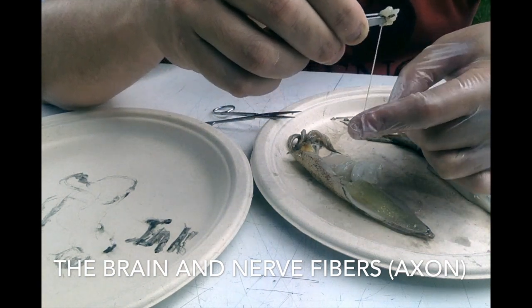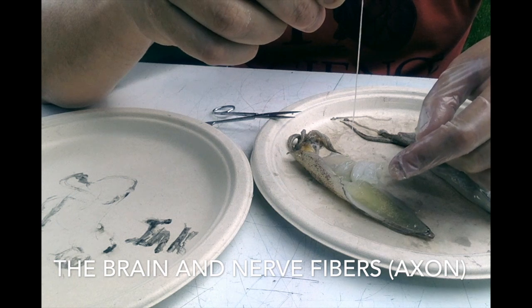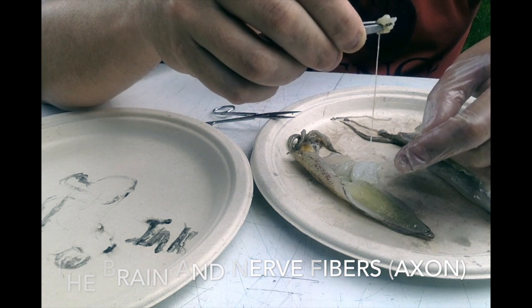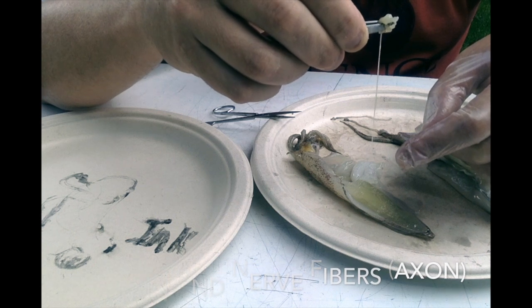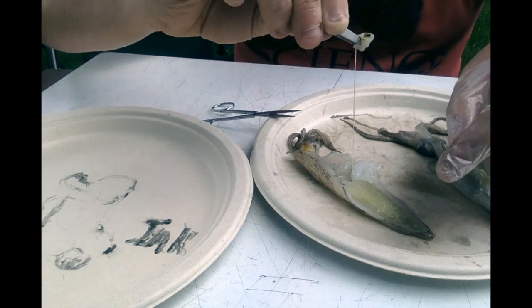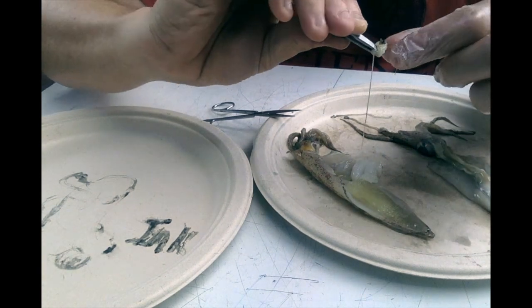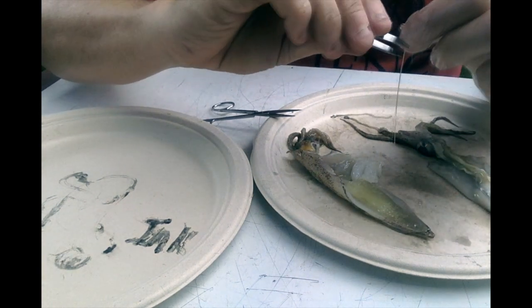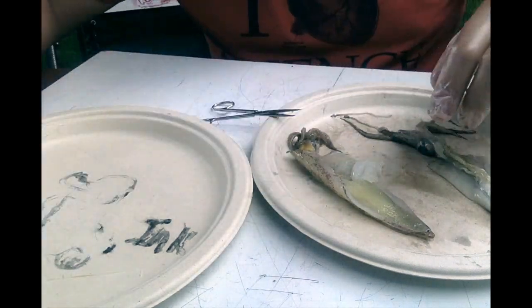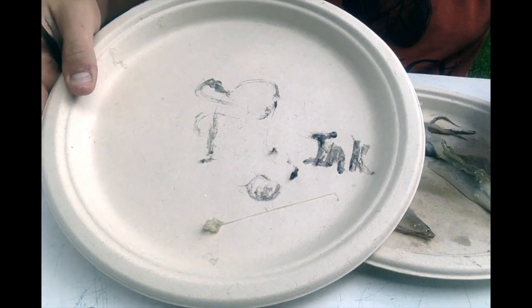And this long axon is this incredible part of the nerve that helps really send messages quickly throughout the squid's body. This is a really important adaptation of the squid. This allows them to send messages across their body really, really rapidly. And it's really kind of cool that they have that.